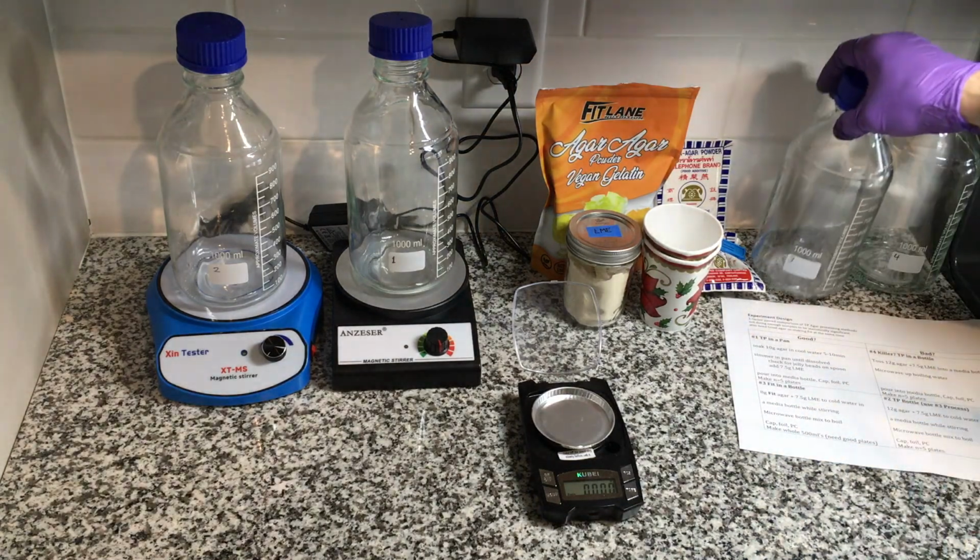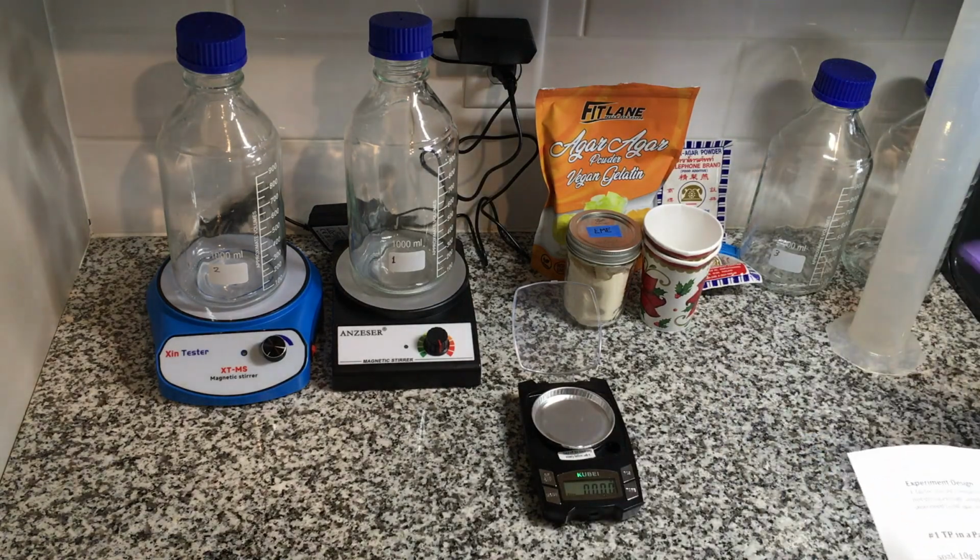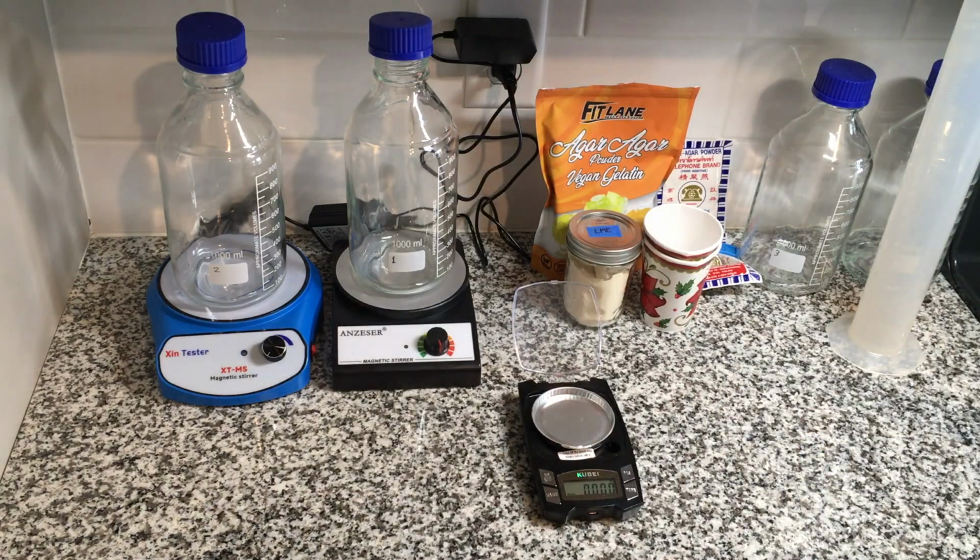I ran some side-by-side tests with tissue clones on the old and new agars. The new agar grew, the old agar didn't, and I thought that was the end of the story.